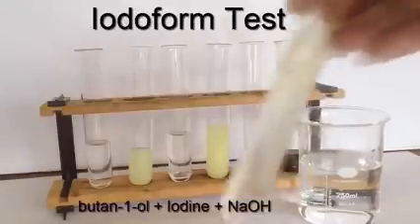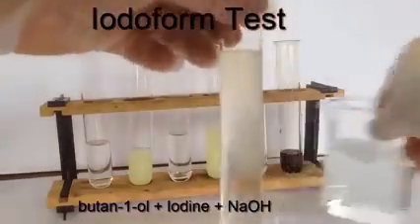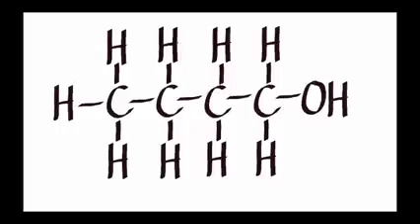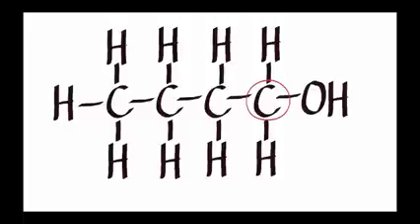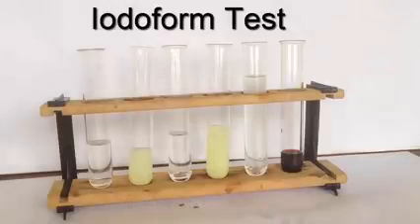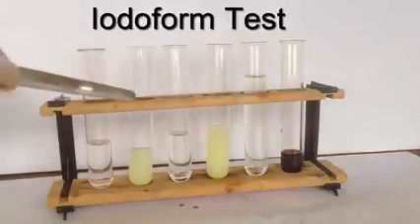And at this stage I was convinced that it wasn't the yellow precipitate. Certainly no yellow precipitate there. And at the bottom you can see it has gone colourless and clear. Here's the structure of butan 1-ol. There's the carbon that's attached to the OH. You can see that it does have a H attached, but it doesn't have a methyl group. It has a propyl group instead, and that won't do.